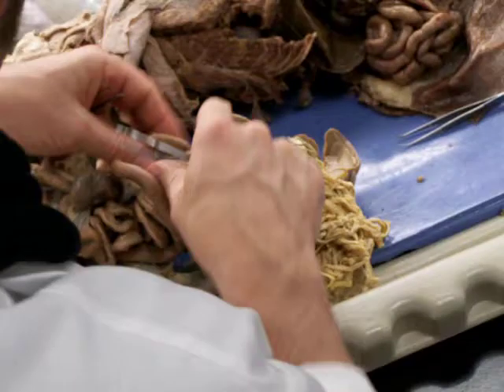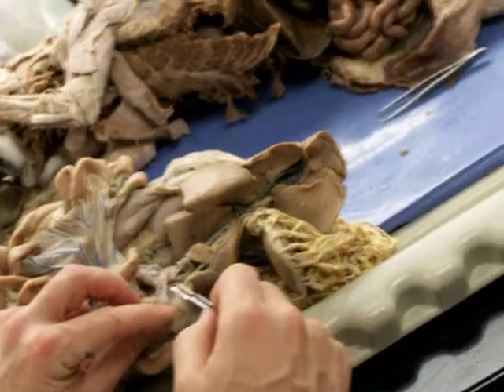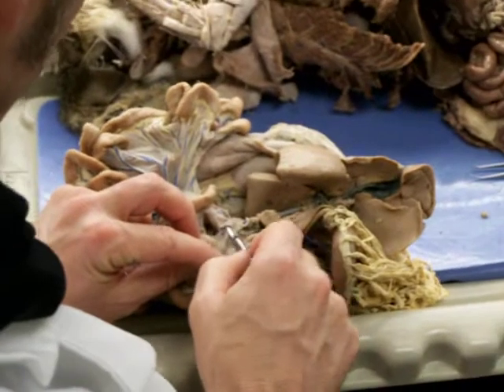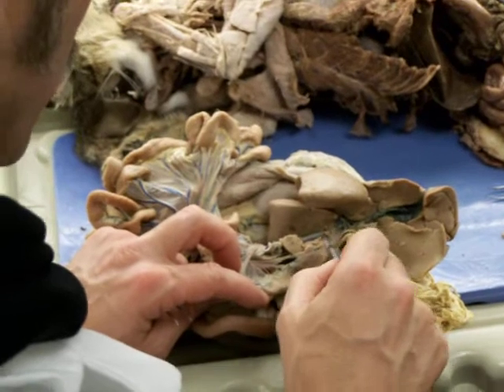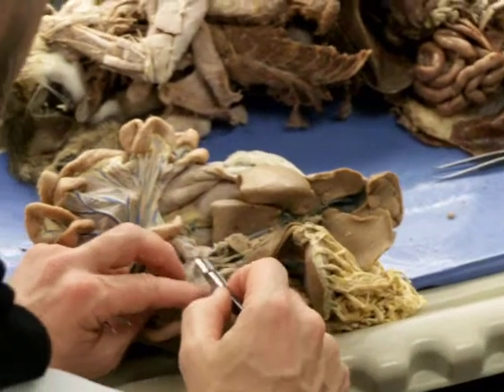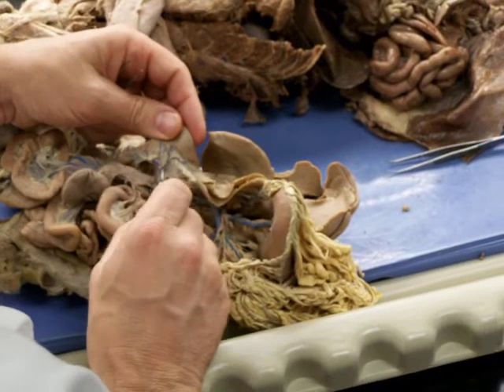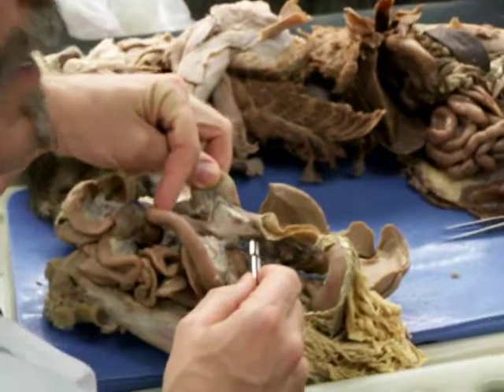That's going to be a little one, as you can probably see it better here. Here's the duodenum right here, and this vein that comes up right in here is going to go up along the duodenum and anastomose with the cranial pancreatico-duodenal. This little vein right here is the caudal pancreatico-duodenal right there. And that dumps into the cranial mesenteric.